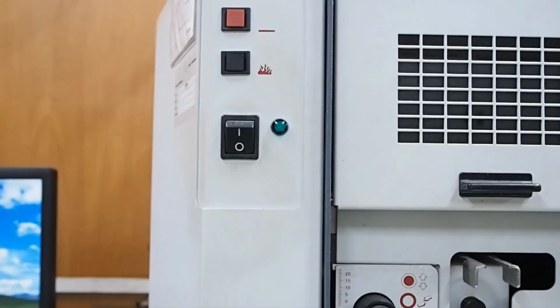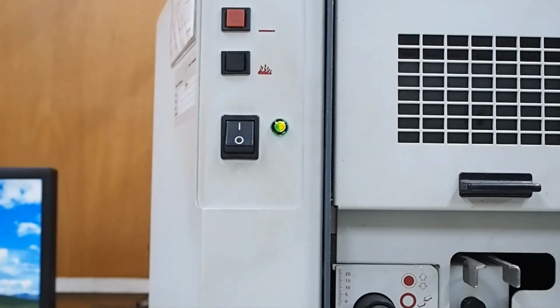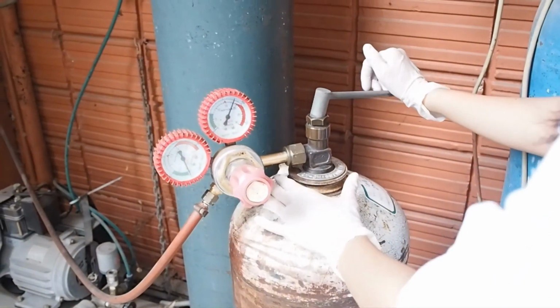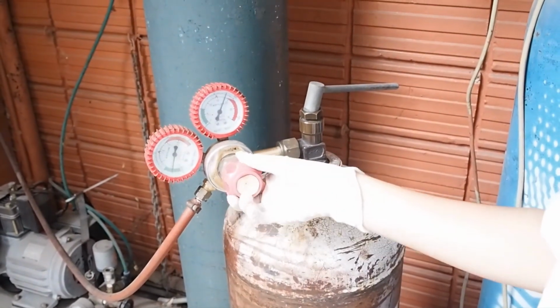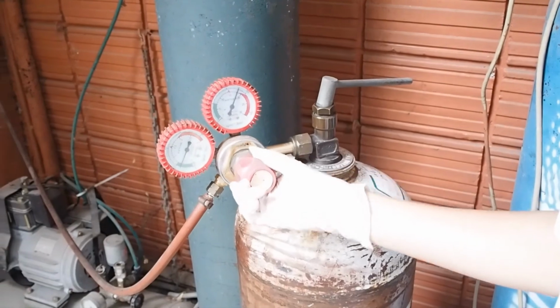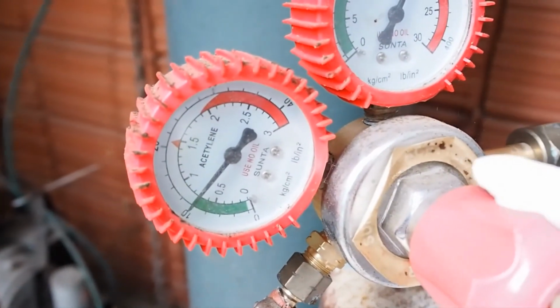We will use the standard set of 0, 0.4, 0.8, 1.2, 1.6, and 2 ppm. And the curve should be linear to about 2 ppm. And an oxidizing flame is recommended.